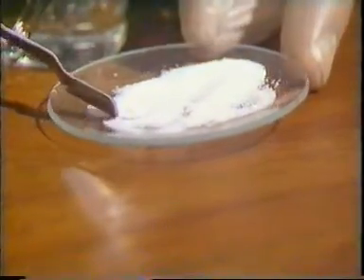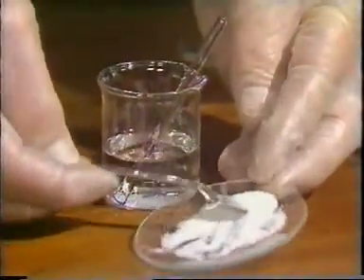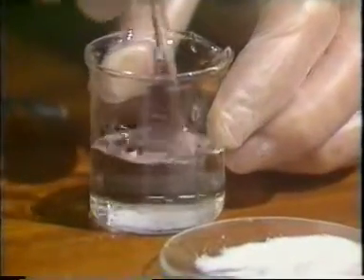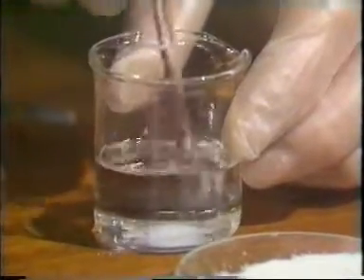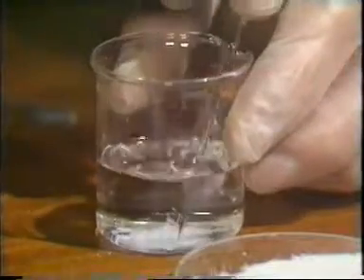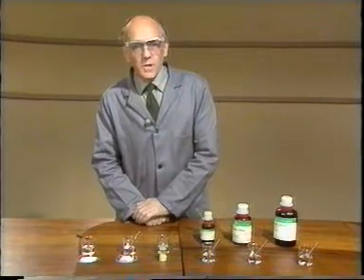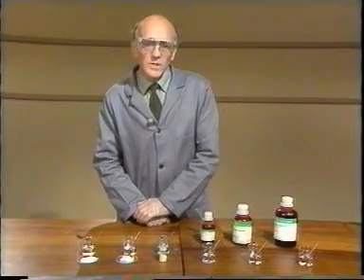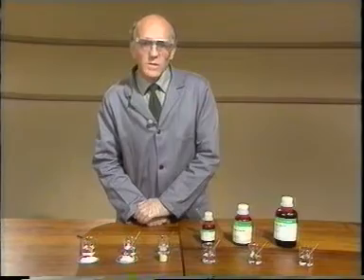If I add some sodium chloride to hexane and stir, there's no sign of the solid dissolving at all. So if the rule of like dissolves like applies, then we might expect ionic substances not to dissolve in hexane, whereas the covalent substances perhaps will. Let's try the rest, and this should enable you to classify these chlorides as covalent or ionic.